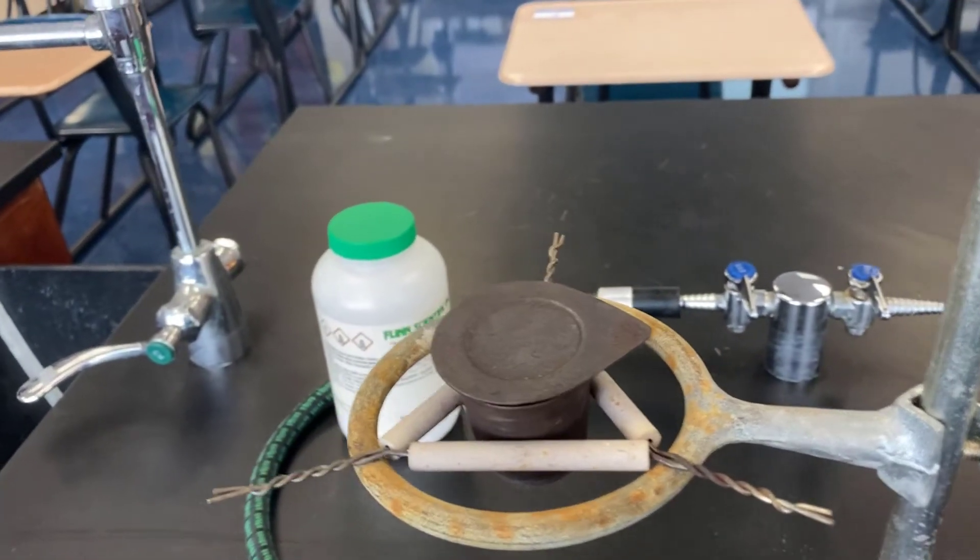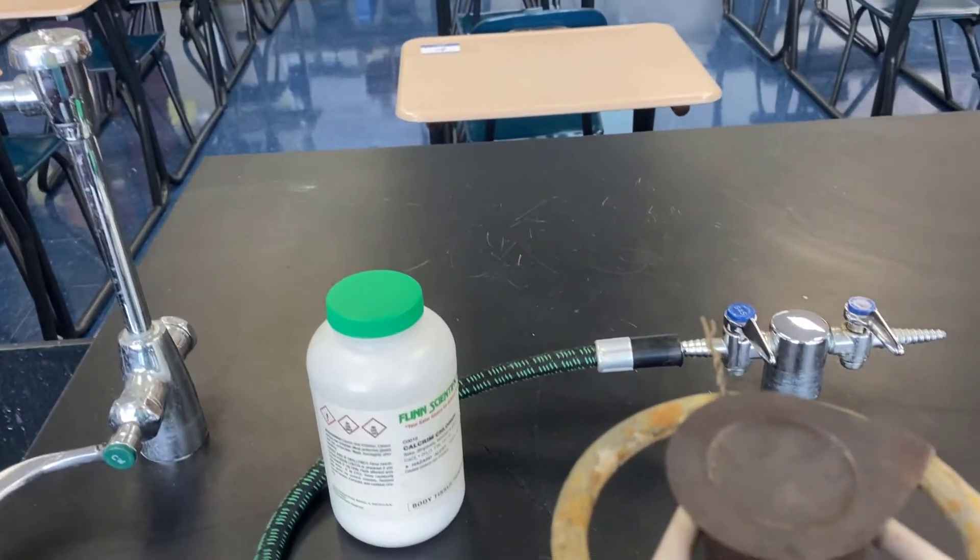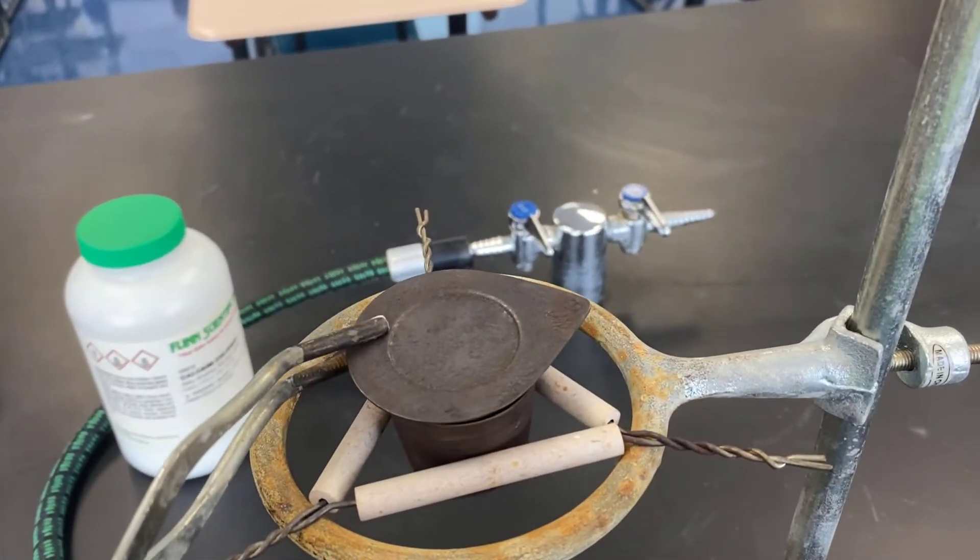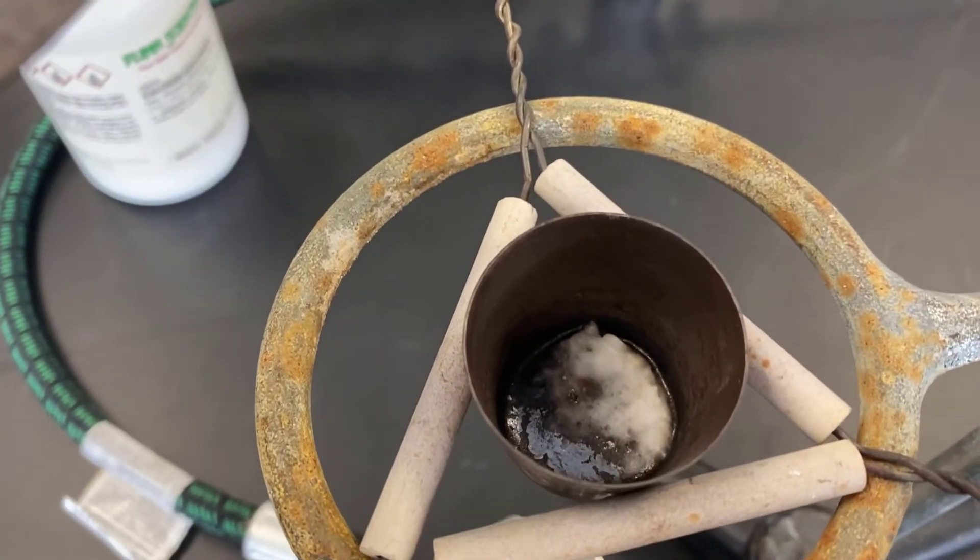Afterwards, we'll let the vessel come to room temperature and then we'll go ahead and put it on the scale. You can see that the contents may have changed, some of them quite drastically.